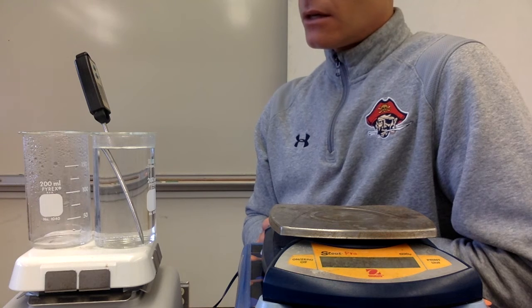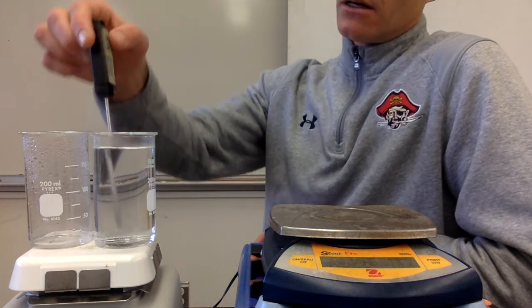Almost done. We just have a little bit on the bottom of that beaker, so we're getting very close to being done.